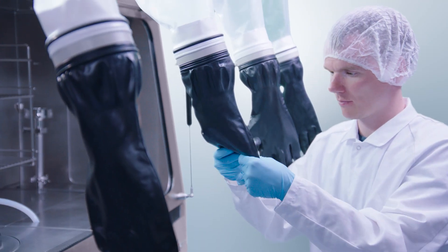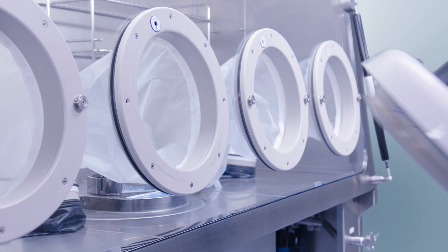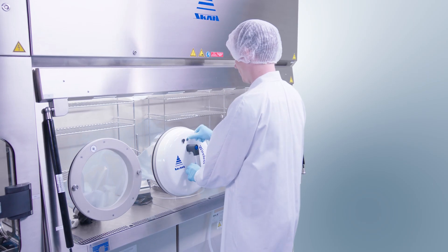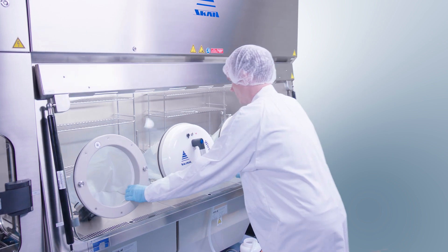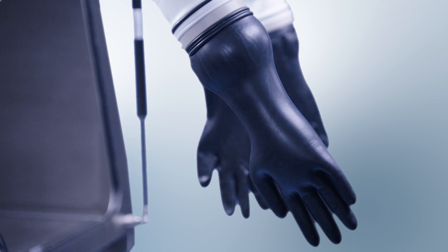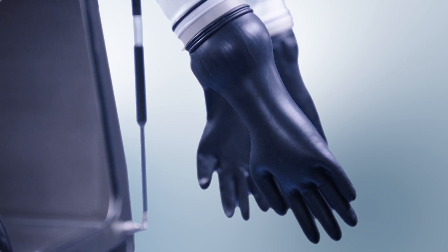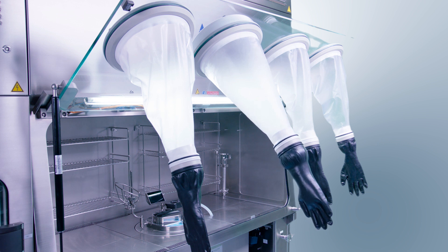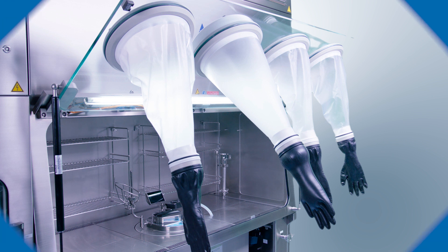Gloves should be inspected frequently. A pressure hold test offers valuable information about the tightness of the glove and sleeve assembly. A test cover with an inflatable gasket provides an airtight seal of the glove sleeve assembly at the shoulder ring. All test data is transmitted wirelessly, and RFID technology identifies the exact glove port number and position.